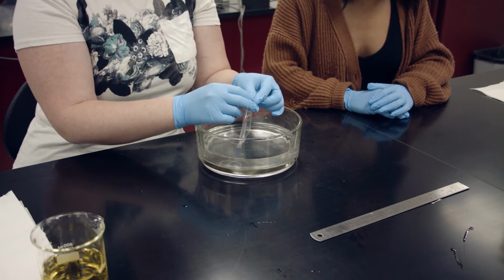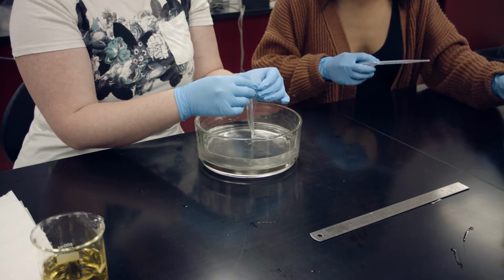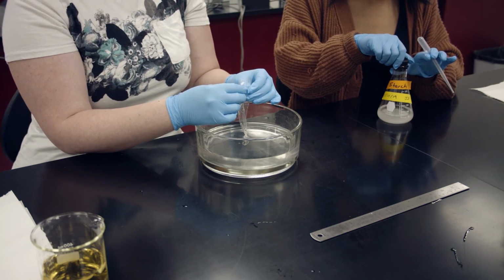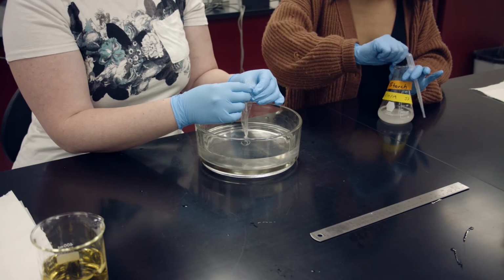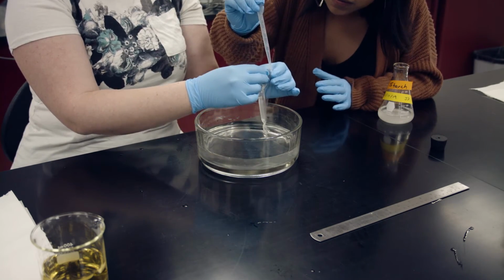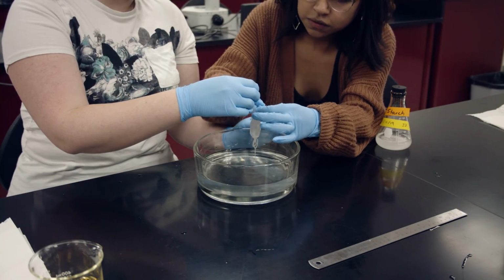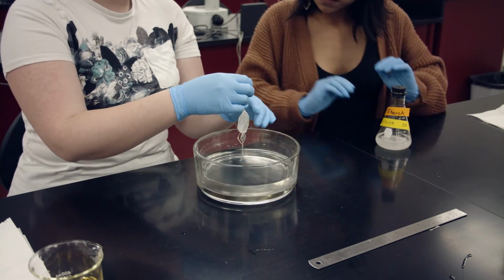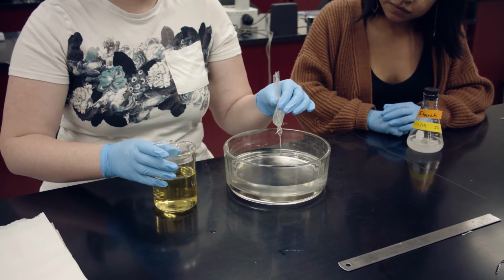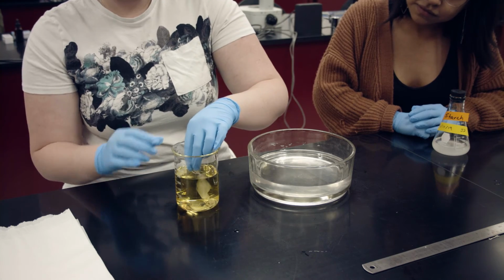Carefully work open the mouth of the other end of the dialysis tubing in the water container such that you now have access to the inside of the dialysis tubing with your fingers. Transfer cornstarch solution into the dialysis tubing until half the dialysis tube is filled. Once half the dialysis tube is filled, tie off the open end of the dialysis tubing using either the string provided or a clamp. Carefully immerse the dialysis bag into a beaker containing 200 milliliters of iodine solution.